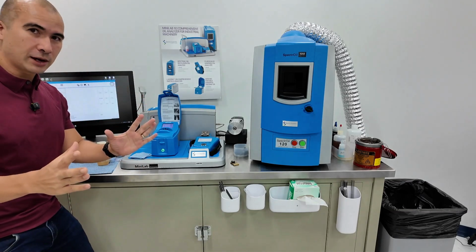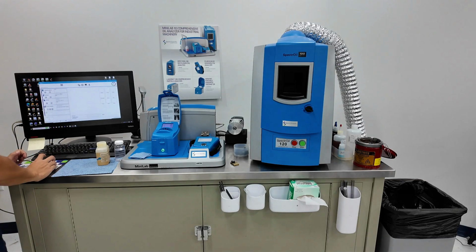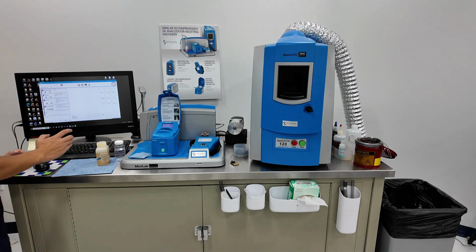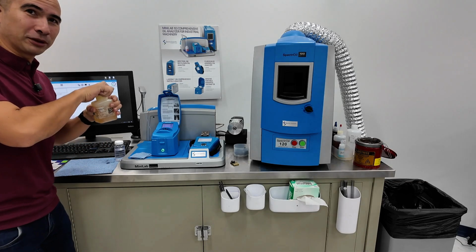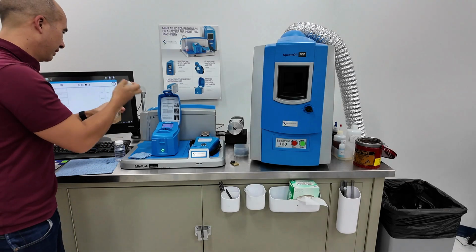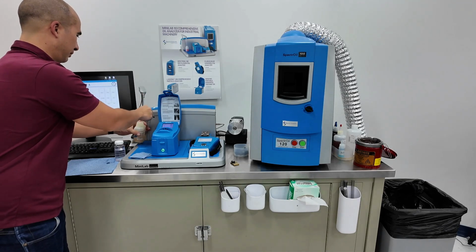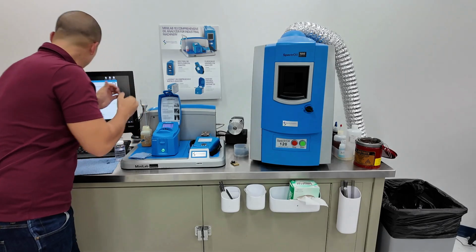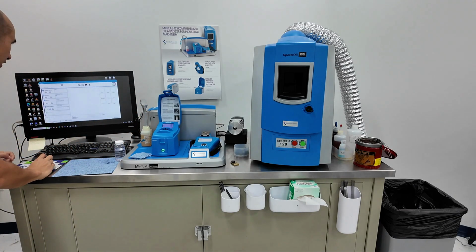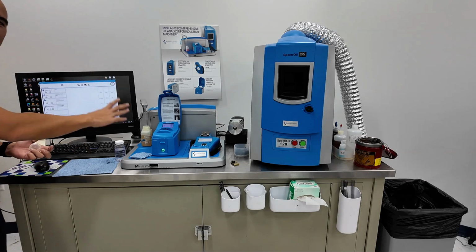So now we're going to do the actual LaserNet Fines. We go into the computer and press play on the particle analysis. Again, this is going to tell us what to do. Insert the sipper tube and click continue. All right, this is the sample we want, one we prepared earlier. Oops, I'm not good at this stuff. All right, click continue. And now it's going to process the sample. That's going to take a little while.